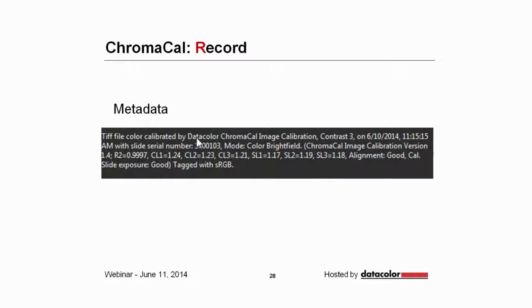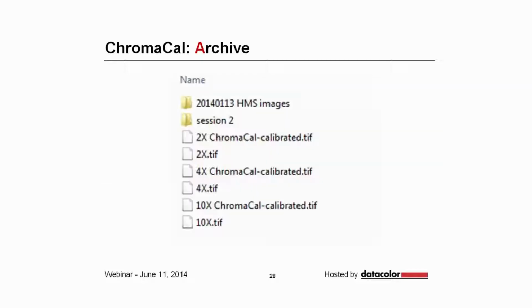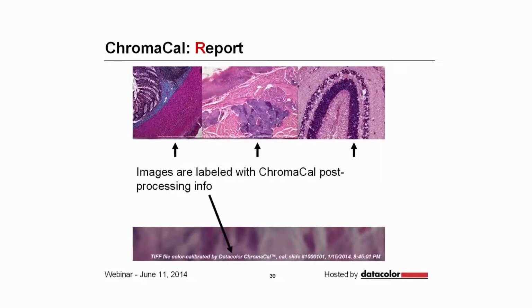So the way the ChromaCal records is it actually puts information in the metadata so that you can find it, and you can see here that the metadata includes that the image was calibrated. There's some contrast information. It also has linearity information and so on. The way it prevents you from saving over your original is it saves a second image, and that image has the words chroma calibrated. And it will also report by a label that you can apply to the image itself, also with information on it that lets you know what sort of corrections and dates and times and that sort of thing.